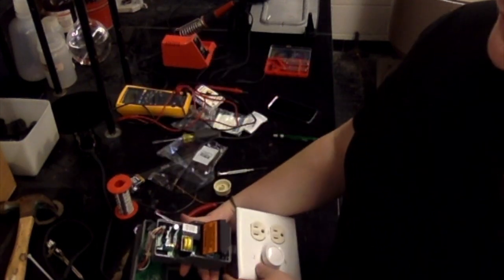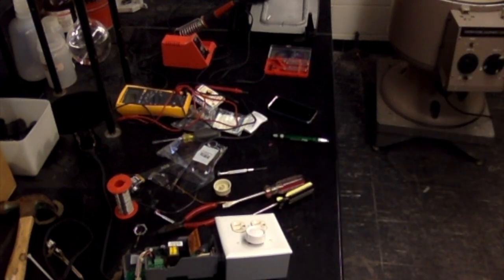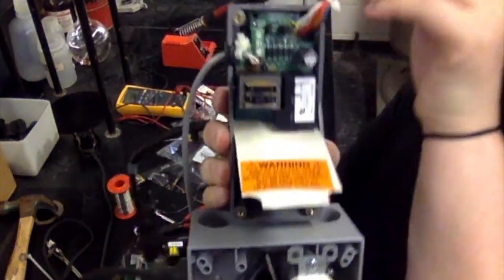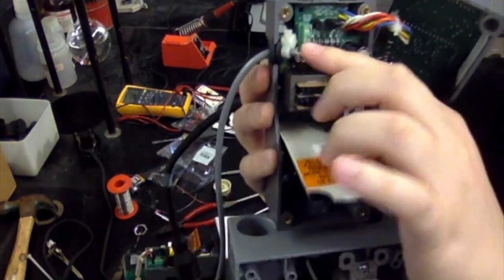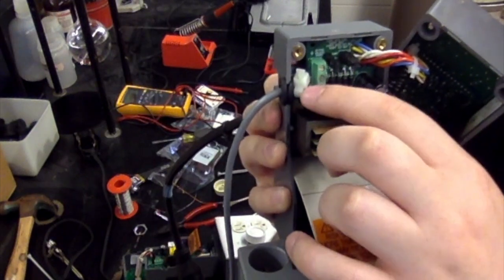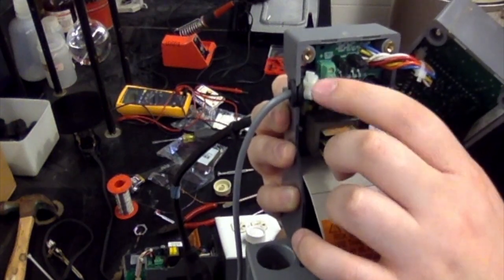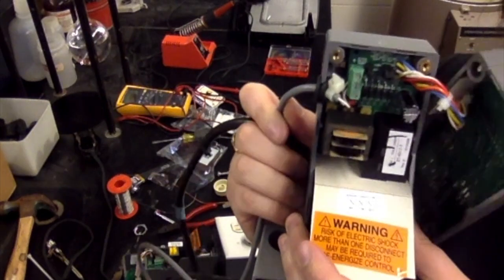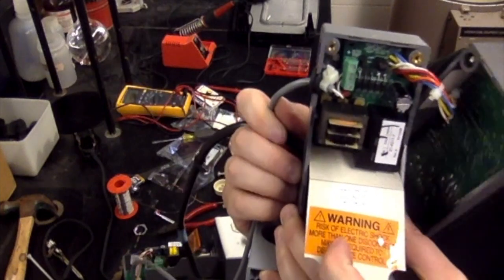So what we do is we have a grommet, and I'll get a finished one of these so you guys can see. You'll put the grommet on the outside of the unit, and then you'll notice that we have a zip tie here that we zip tie the lead from the thermocouple into the unit on the outside. And this again is just making sure that the strain is on the zip tie, it's not on the set screws from the bare leads.